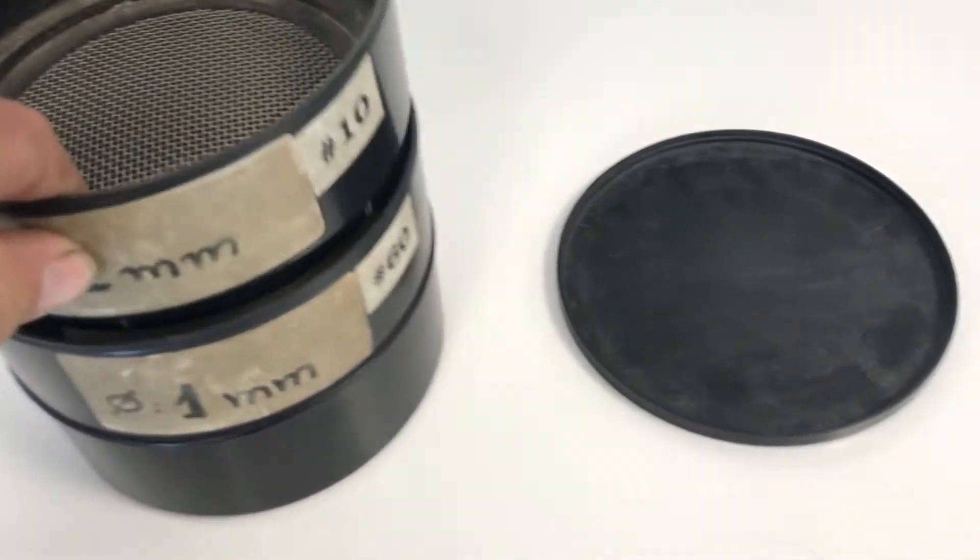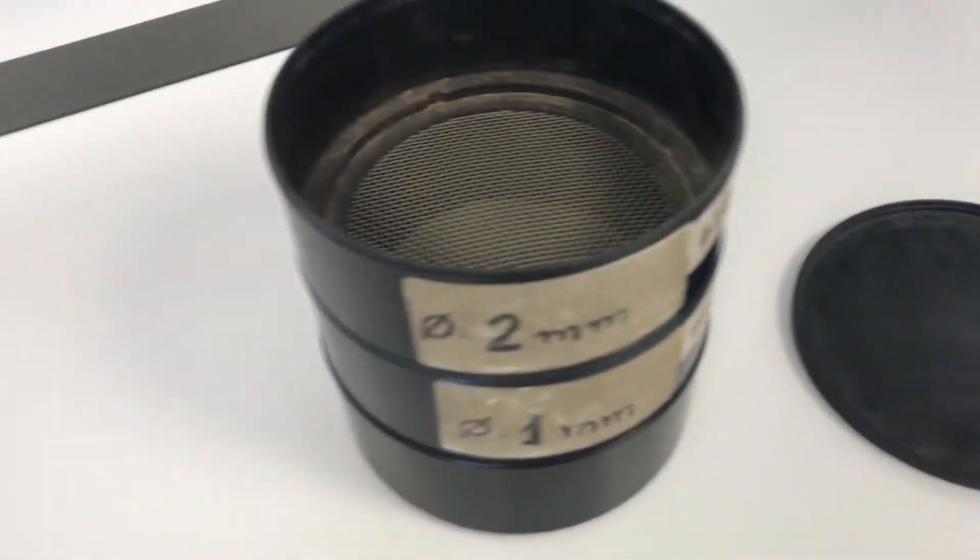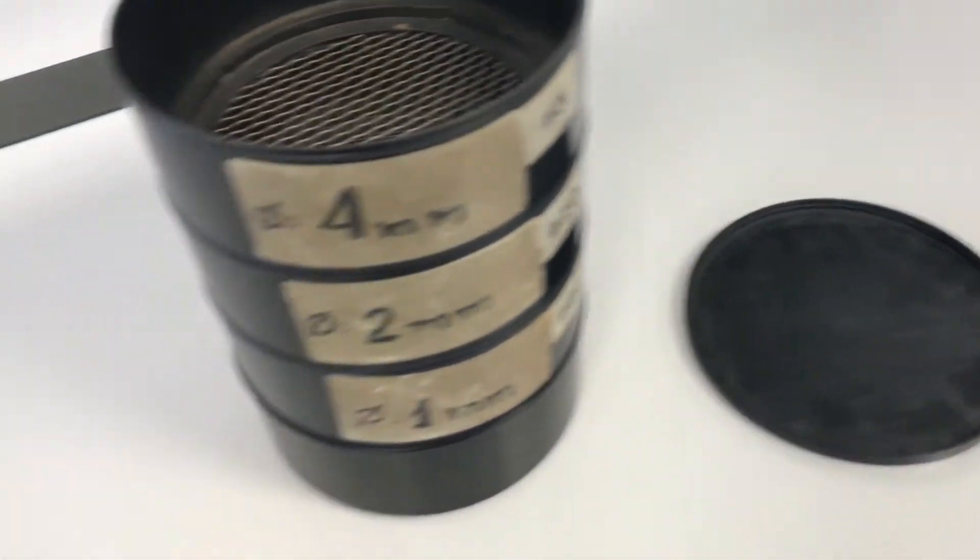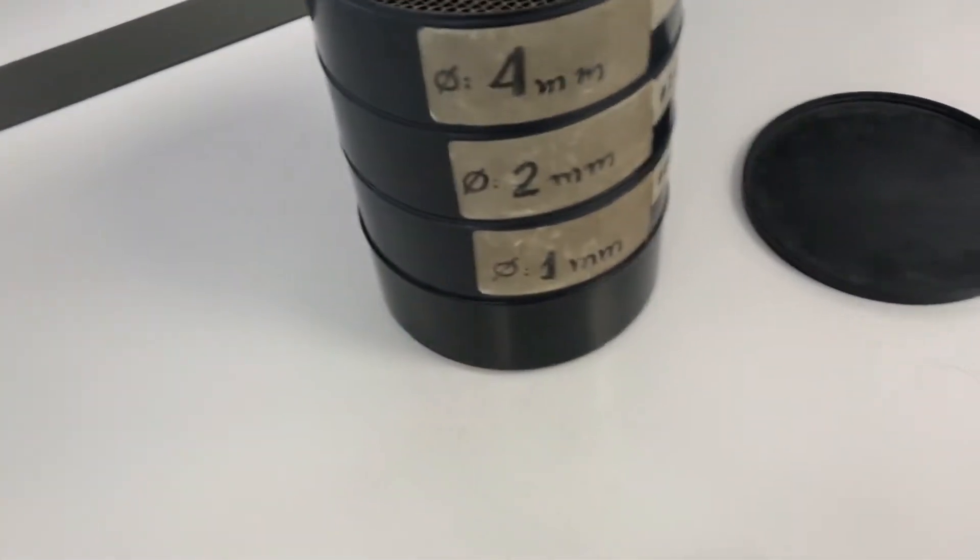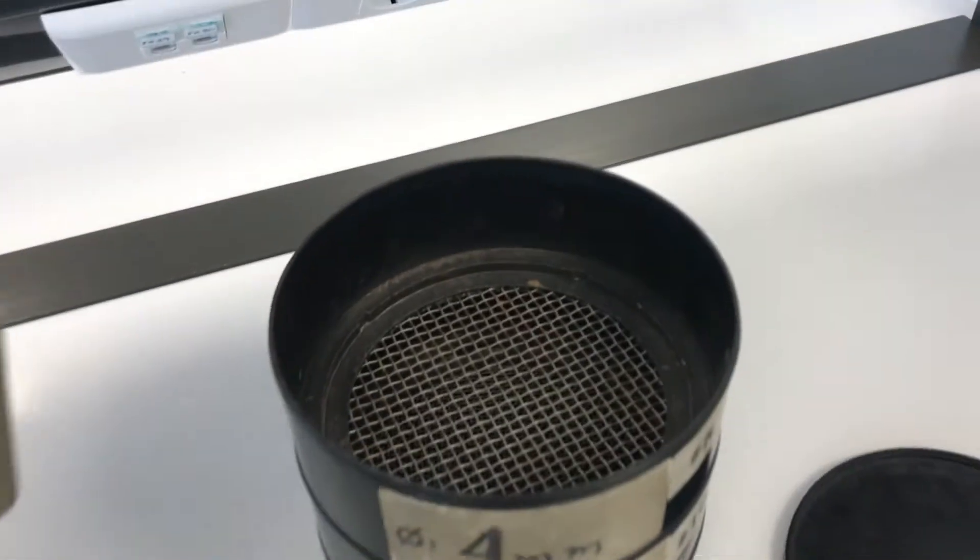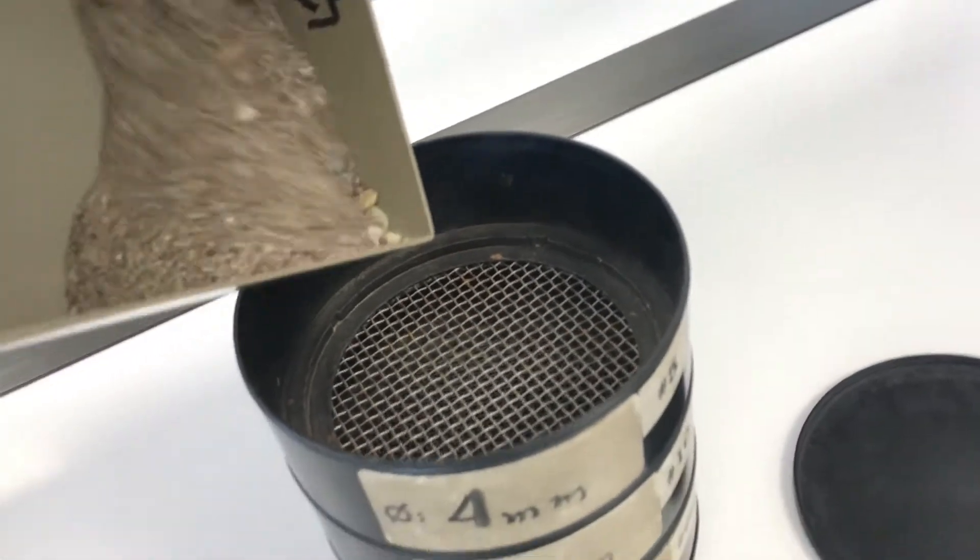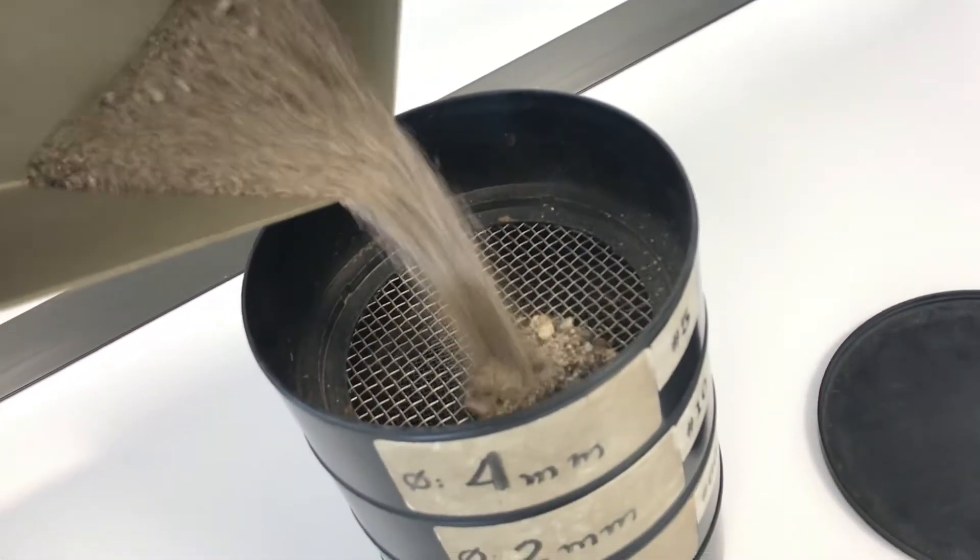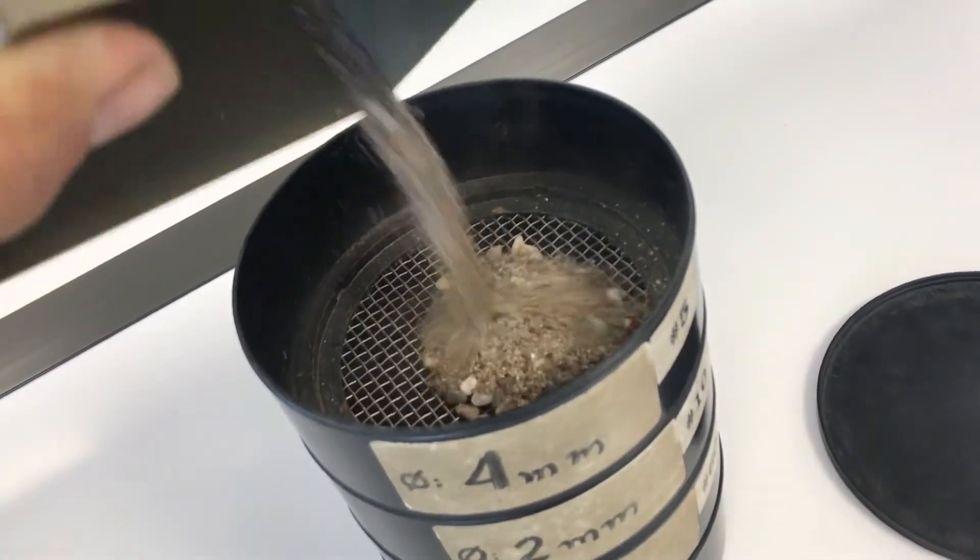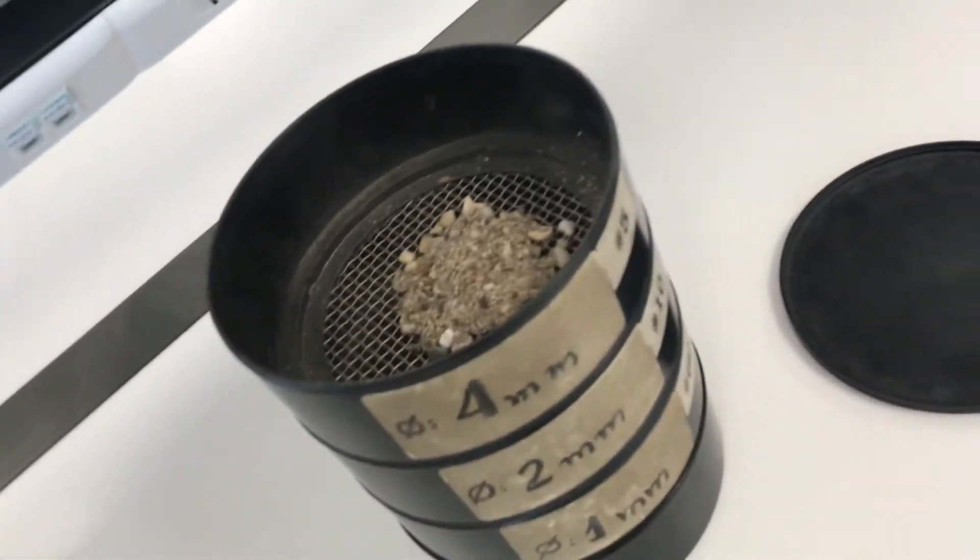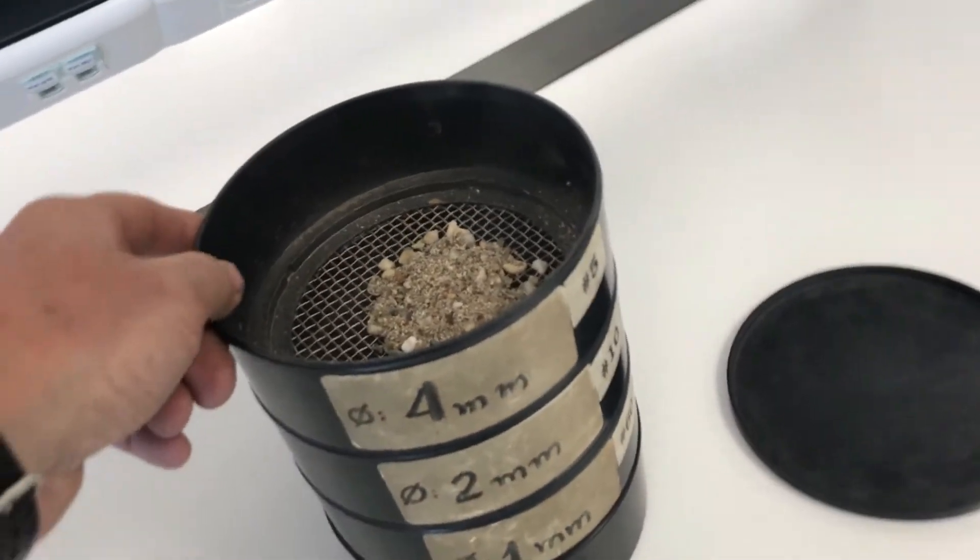And this is the end, and then we set up in this context, we're starting from the coarsest and we're moving towards the finest. And then we pour a certain amount of sediment sample we have baked already.